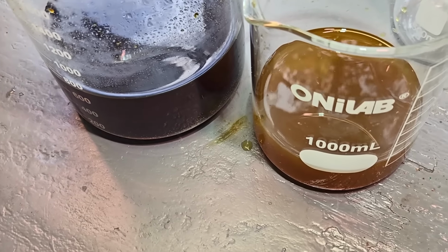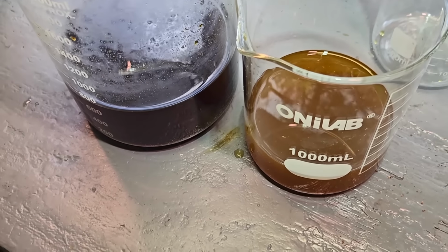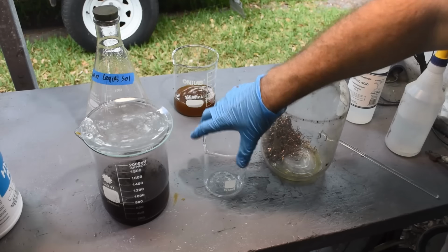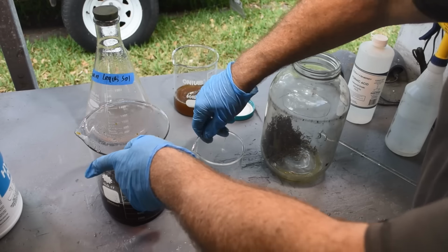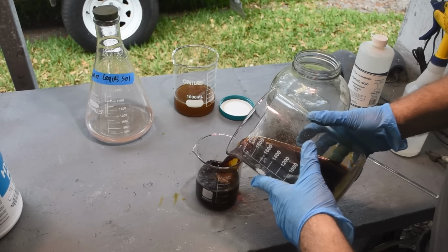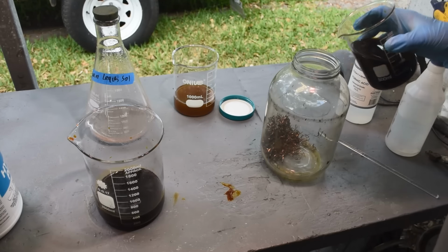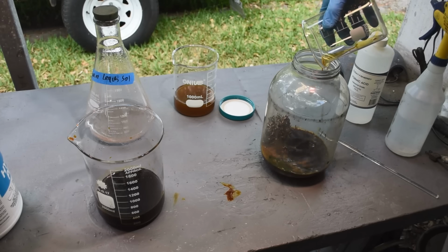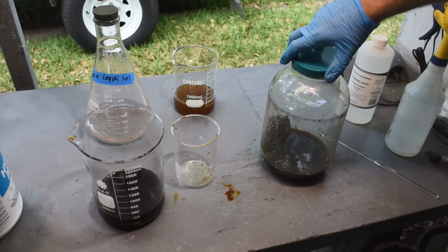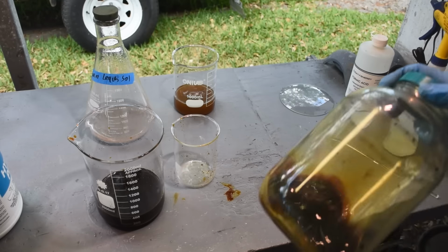Let me measure out another 300 milliliters, and we'll do it again and see what the pins look like after another 15 minutes. Okay, and we'll just keep adding our spent liquid to that. Let me measure out another roughly 300 milliliters of this stuff. The good purple stuff here. Oh, I'm making a mess as per usual. That in there. Lid it up and get it back on the machine for another 15 minutes. Let's see how it goes.